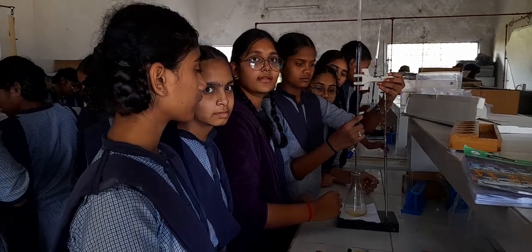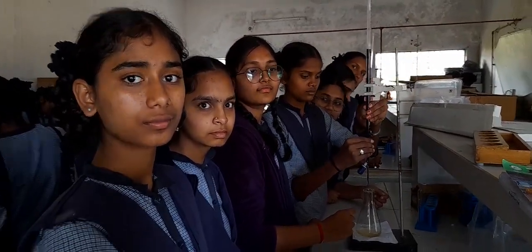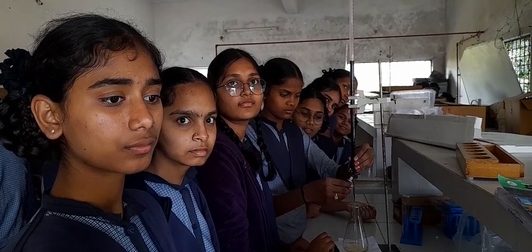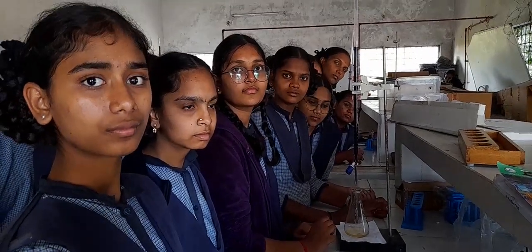Good afternoon, viewers. Today we have our MPC students with their volumetric analysis. Today they are doing the titration of KMnO4 against ferrous ammonium sulfate, that is Mohr's salt solution. So let's speak to them.